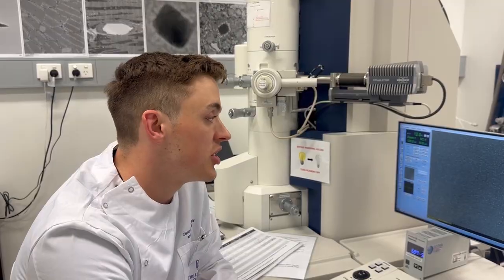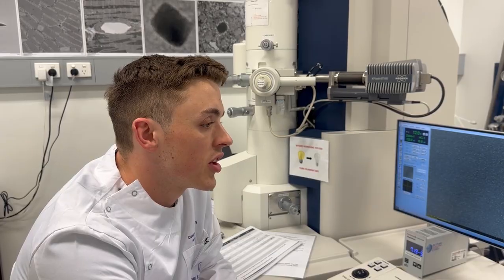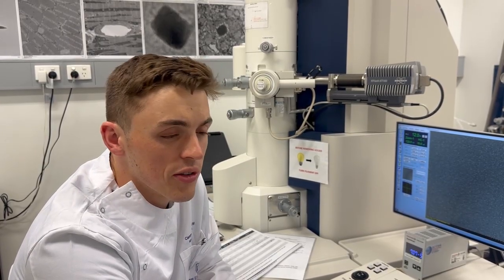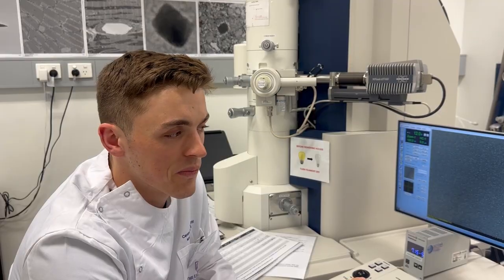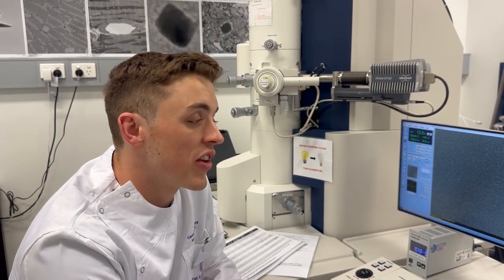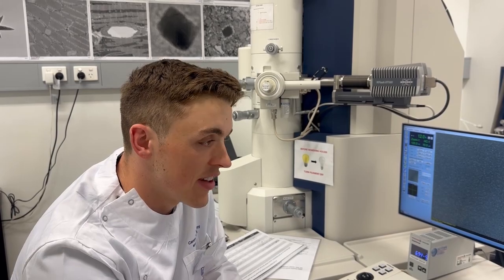After a bit of pushing, he tentatively offered his opinion. But generally, Q does look nicer. There are more distinct particles. They look much more uniform than the other construct, which is labeled Z here.